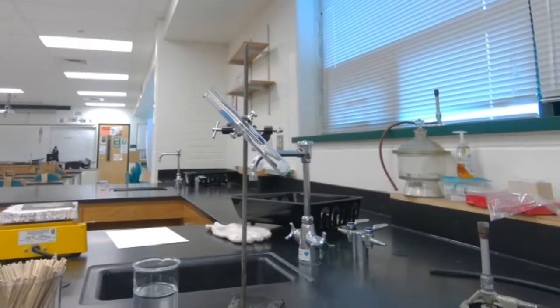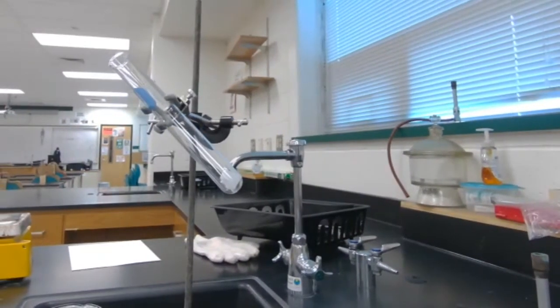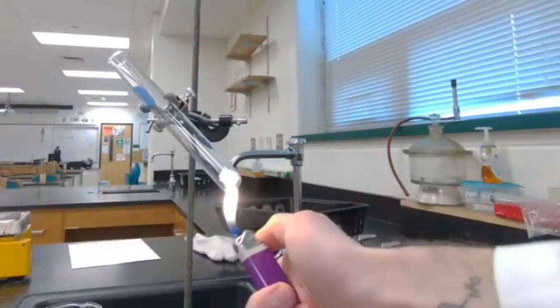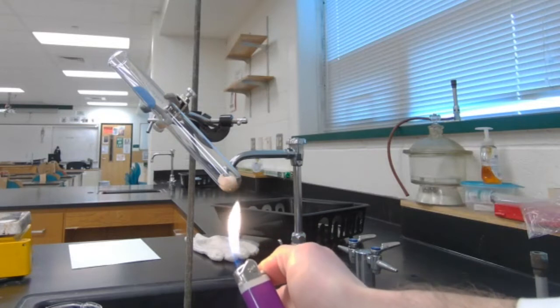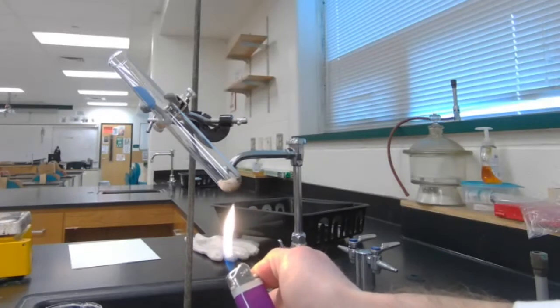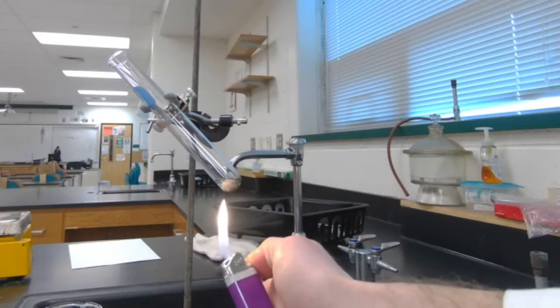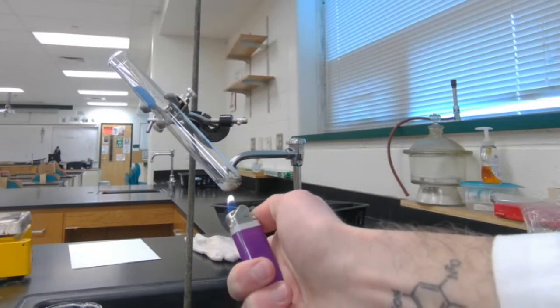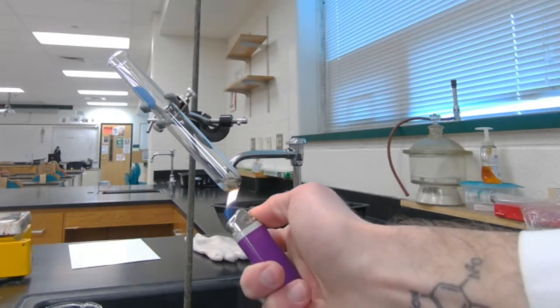Okay, so what we have here to start us out is a piece of wax. I'm going to zoom in there a little bit. Okay, a piece of wax in the test tube, and we're going to see what happens here when I put the flame here, and get some change there. So again, you want to record your observations for this, in the table provided.